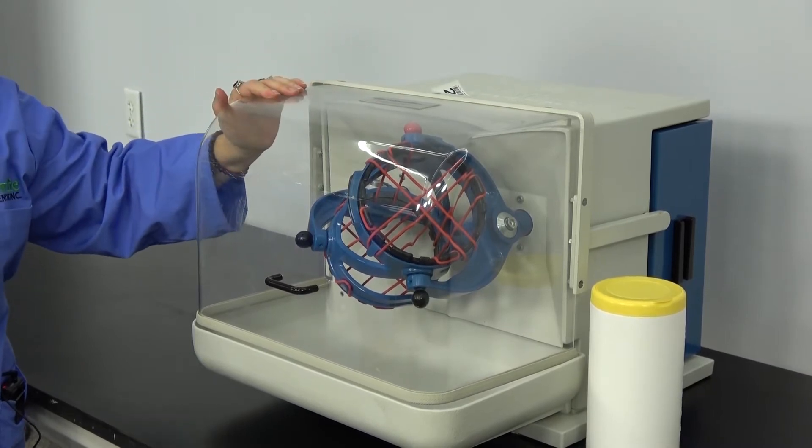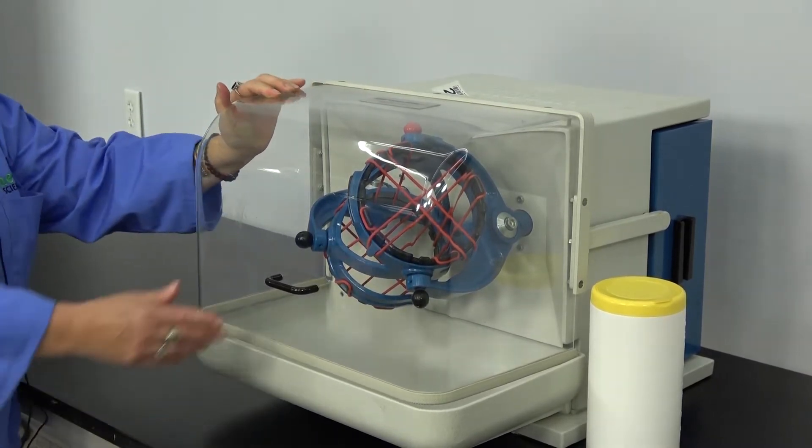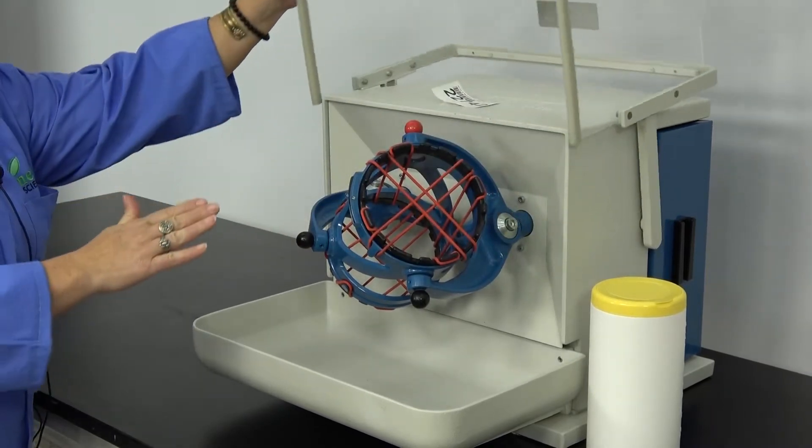We're going to give you an example of loading it and running it. You lift the safety shield.